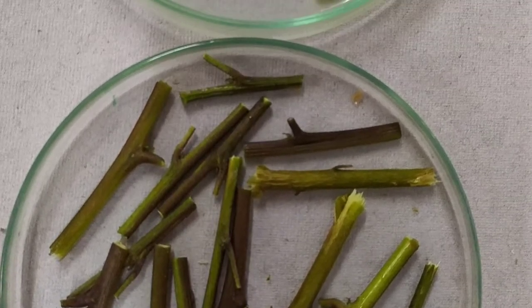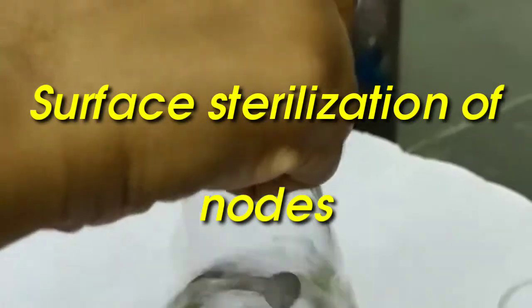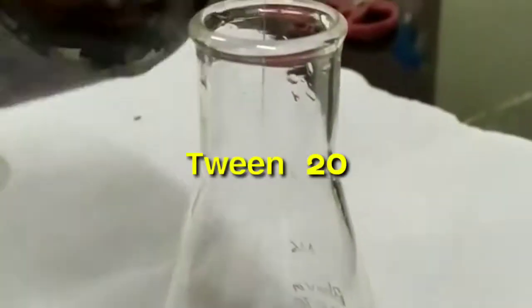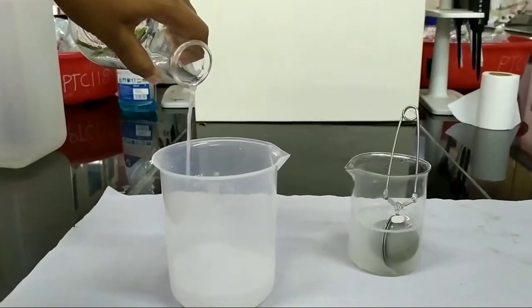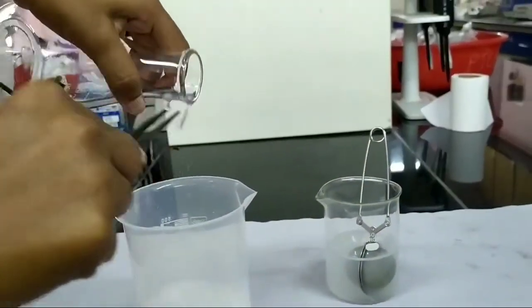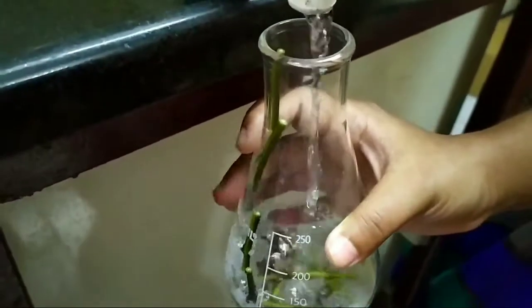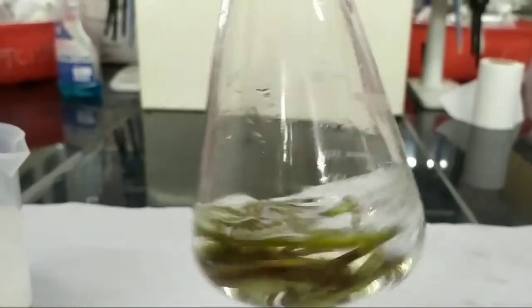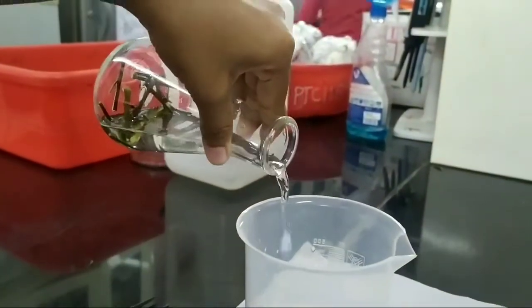The explants collected from the mother plants were nodal segments and seeds, which were first thoroughly washed in running tap water for about 20 minutes. The nodal explants and seeds were rinsed with 2-3 drops of Tween 20 in 100 ml of distilled water for about 15 minutes. Tween 20 is a mild non-ionic surfactant used as a wetting agent. The explants were then treated with 1% Bavistin for about 15 minutes, with the solution placed on a stirrer to provide uniform contact between chemicals and explants, followed by treatment with 1% chlorine water wash for about 15 minutes. After 3 rinses with distilled water, the explants were taken to the laminar airflow chamber for further sterilization.